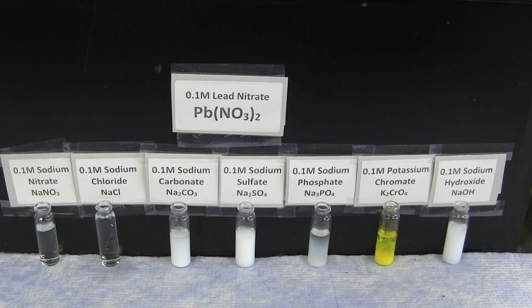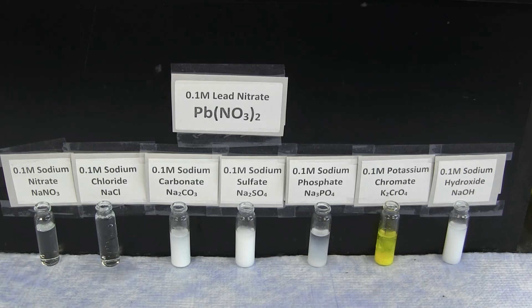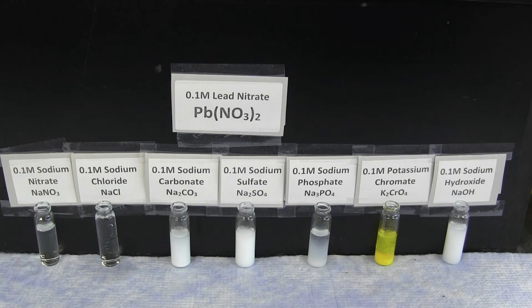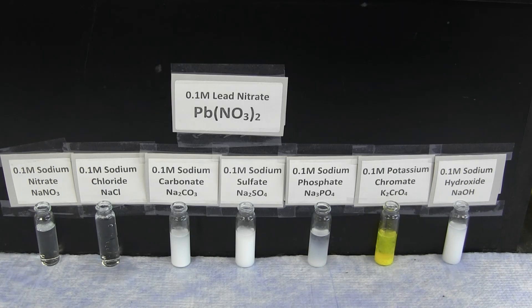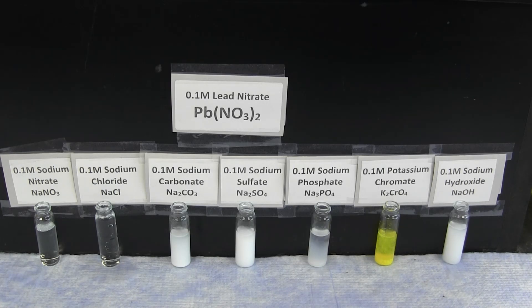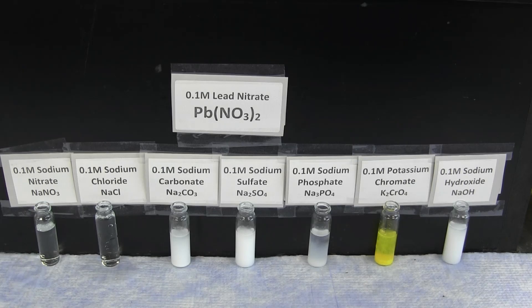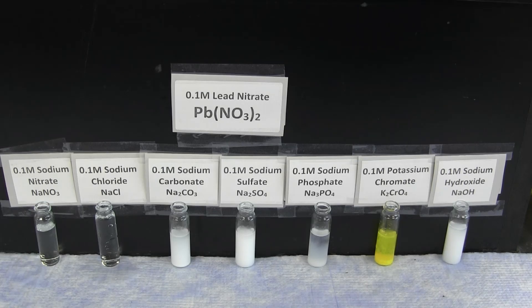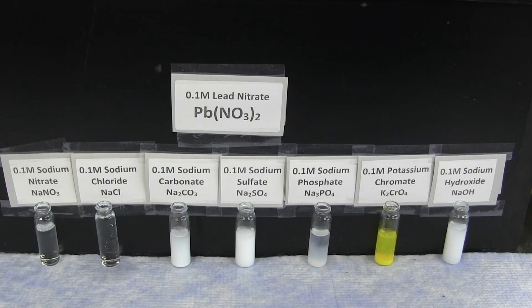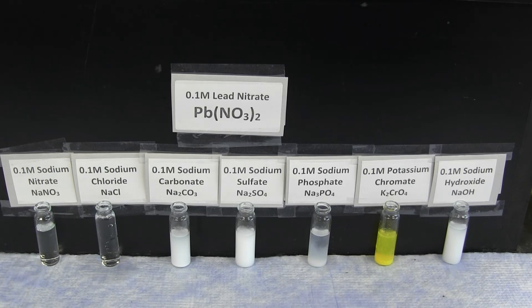The lead ion forms a white precipitate with sodium carbonate, sodium sulfate, sodium phosphate, and sodium hydroxide, as well as an intense yellow precipitate with potassium chromate.